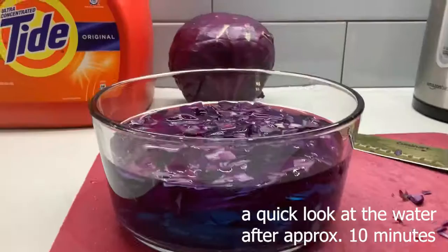A more basic condition causes degradation of the high stability that anthocyanin pigments have in the acidic conditions. Additionally, anthocyanin loses an OH at acidic pHs but gains an OH group at basic pHs. So generally, we already know that an acidic solution has extra protons, or H+, while a basic solution has less free H+ protons. So by this knowledge, we can explain how the structural changes cause physical pH difference in the solution more than just the color change itself.